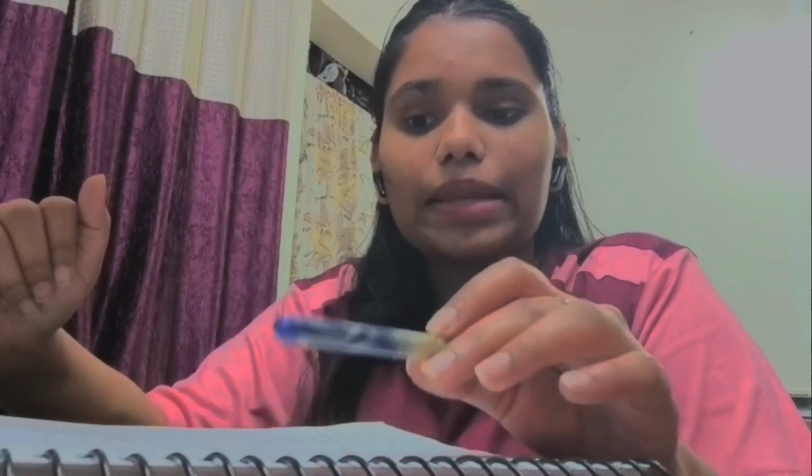One more is it can be applied to a limited area. Like with a chemical or thermal stimulus, the area over which I put the solution or the area that I am heating cannot be controlled. But you can do it precisely by using electrical stimulus, by using small electrodes.